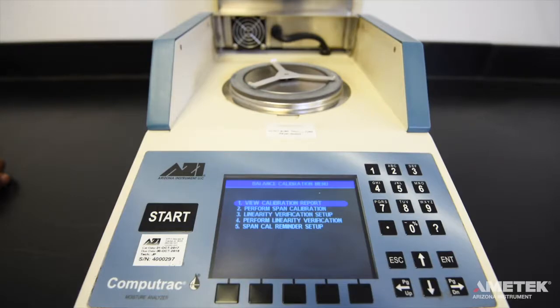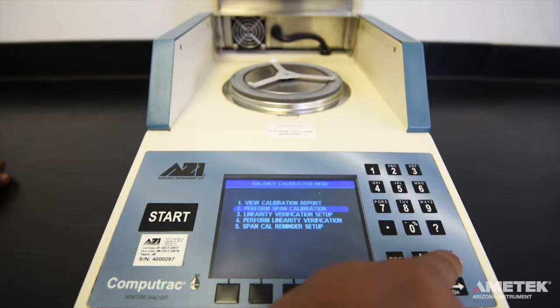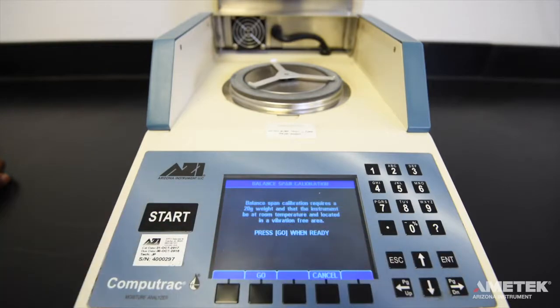Finally, select perform span calibration and press enter. The instrument is now ready to perform the span calibration. When you are ready, press the go button and follow the instructions on the screen.